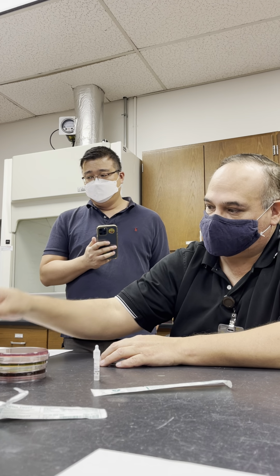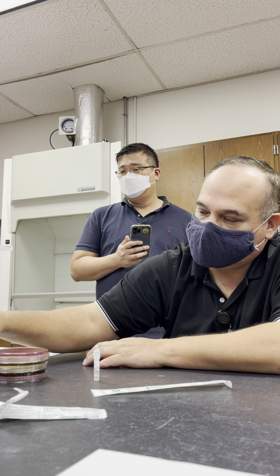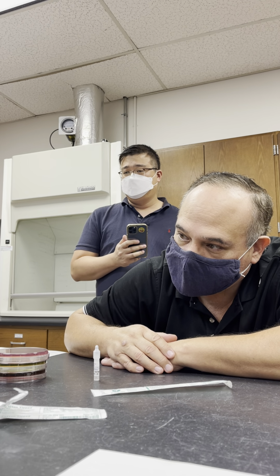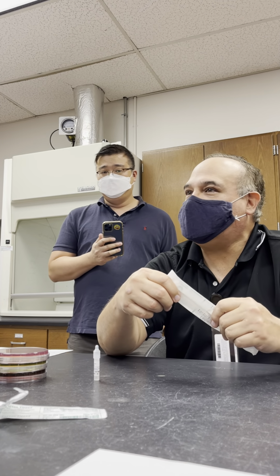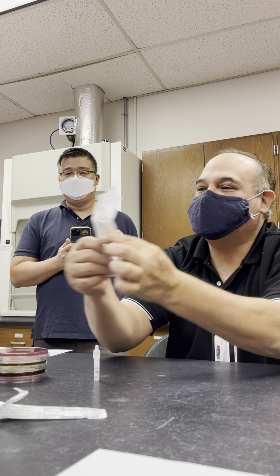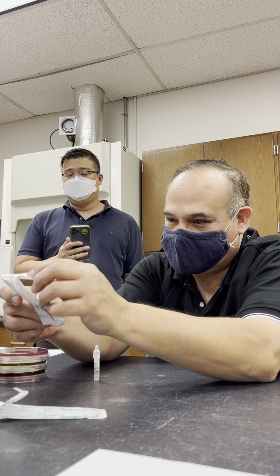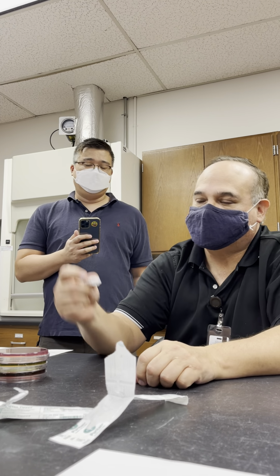Non-enteric. So pick an organism, one of these, anyone. Okay, so she picked Proteus mirabilis. That's the exact same one they picked this morning. There must be something in the air. It's the closest one, but yeah. Okay, go ahead and get a sample.